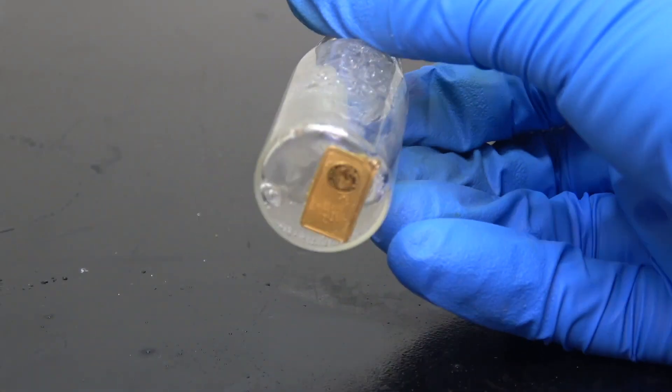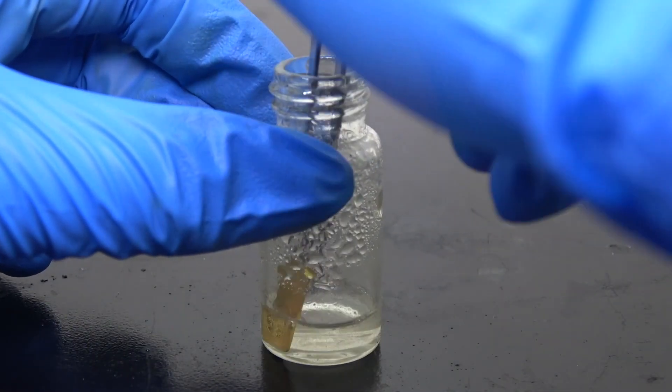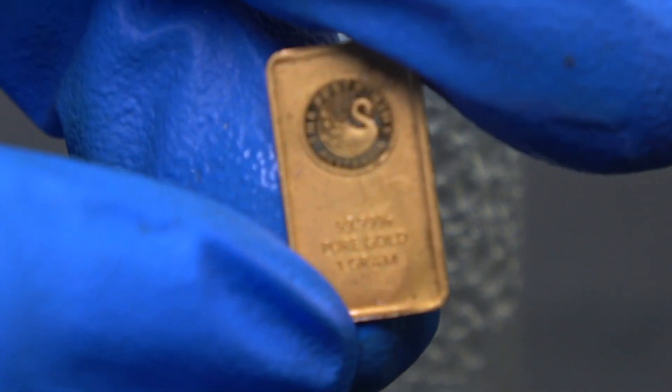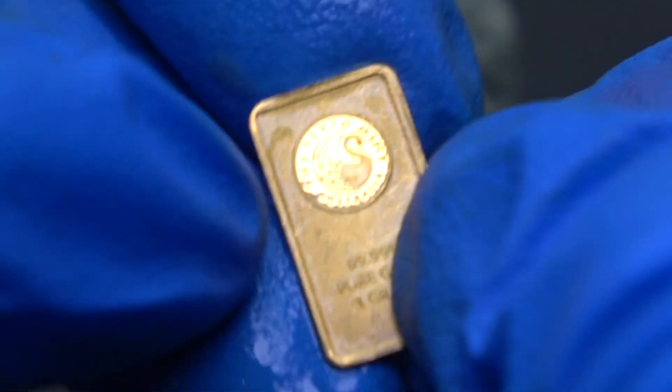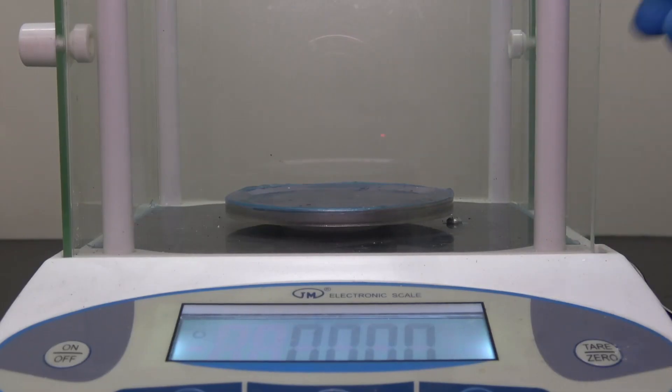Anyway, a bit off topic there. Let's go ahead and fish out the vial. I must say that I'm not very gifted at using a tweezer. Upon close inspection, there is no sign of any damage other than the scratch mark left by the tweezer. Again, just for making sure, I'm gonna confirm that with my trusty scale. Well, as I expected, no mass was lost.